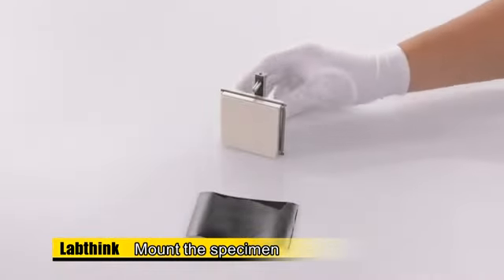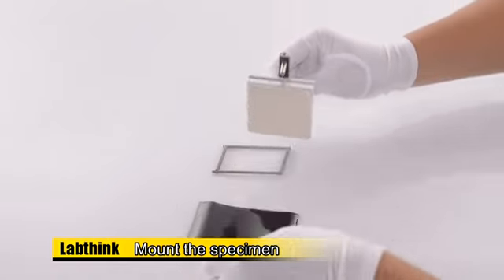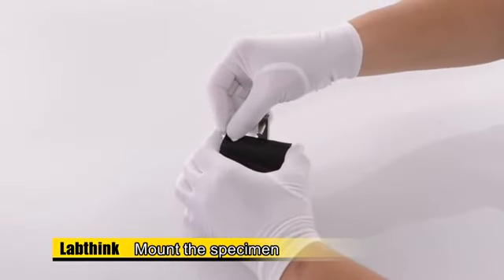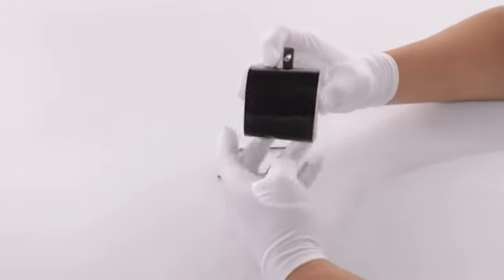Take the 63.5 mm by 100 mm specimen. Put the edges of the 100 mm film specimen to the back of the sled using the specimen clamp, pulling the specimen tight to eliminate the wrinkles.